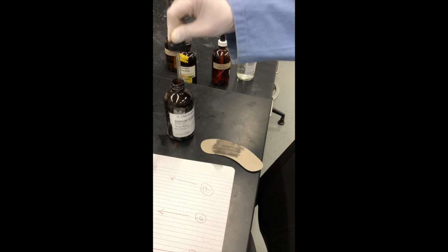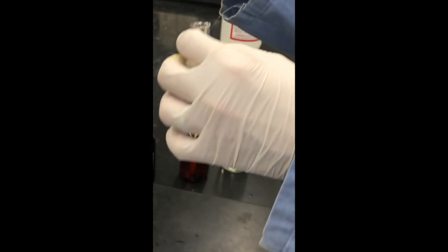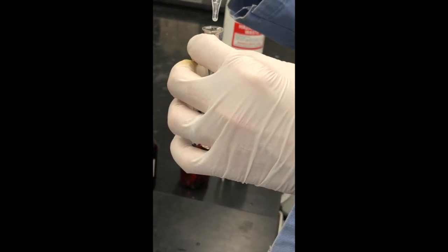Next we'll add sodium iodide to chlorine. Sodium iodide will be mixed into the element chlorine and we will check the upper layer color. Adding a few more drops of sodium iodide — the bottom layer changed dark right away, but we're looking for the upper layer color. There you can see the color of that upper layer very clearly. Finally, sodium iodide is added to iodine, and we observe the color of the upper layer.